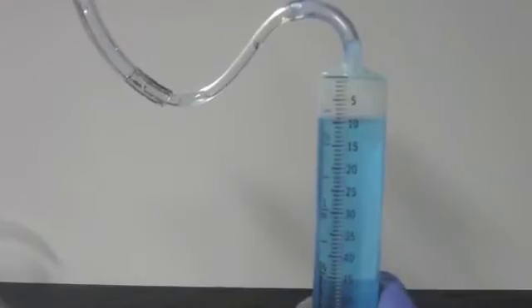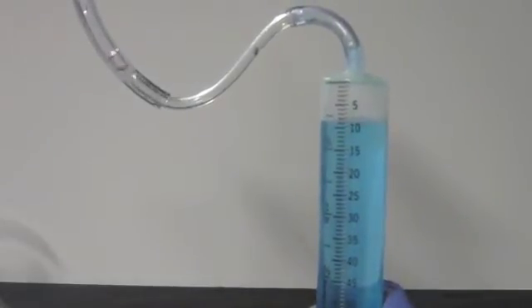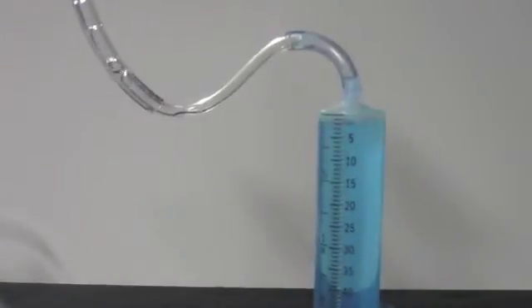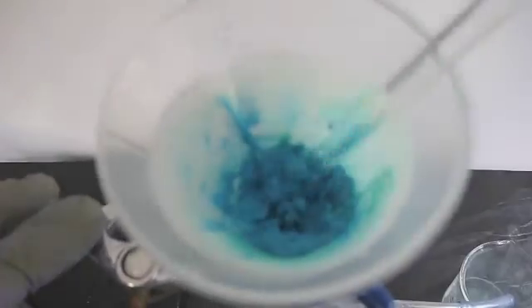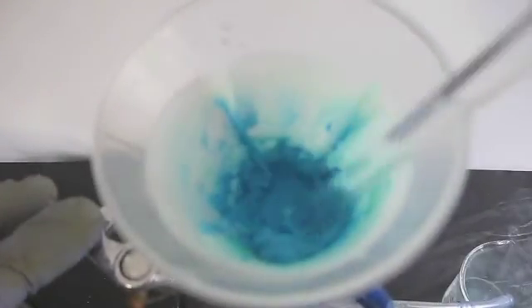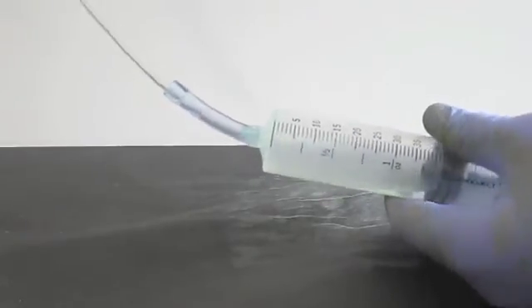And here's a quick tip. To fill the syringe multiple times without having to empty it, invert it and then slowly push out the air. You can now continue pulling more liquid through the filter. After you have filtered, you should be left with either a wet goop or a semi-solid paste. Pull on the syringe several more times to remove all of the water from the tubing.